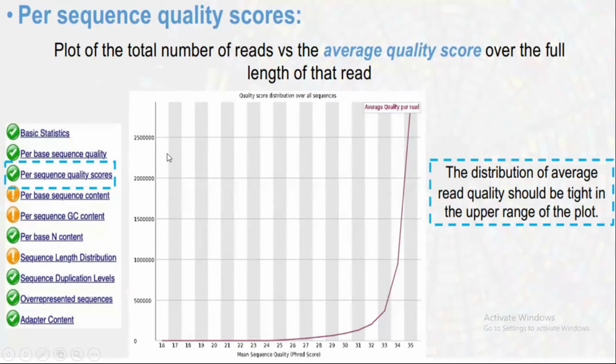So 25 lakh or more of our sequencing reads have a quality between 31 and 35, the entire quality of the sequence read. It means the sequences present in our FASTQ file have good overall quality. So it should be like this. This is the per sequence quality score, and the distribution of average read quality should be tight in the upper range of the plot.